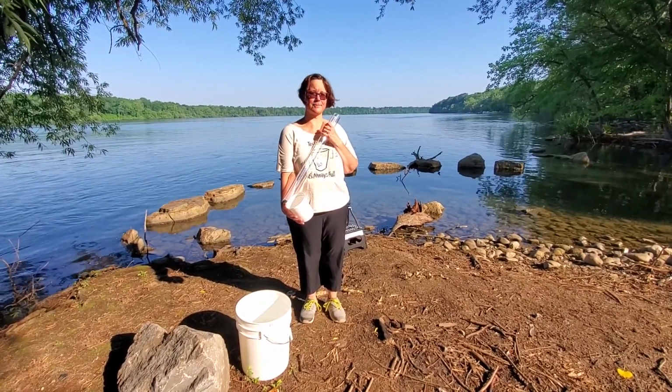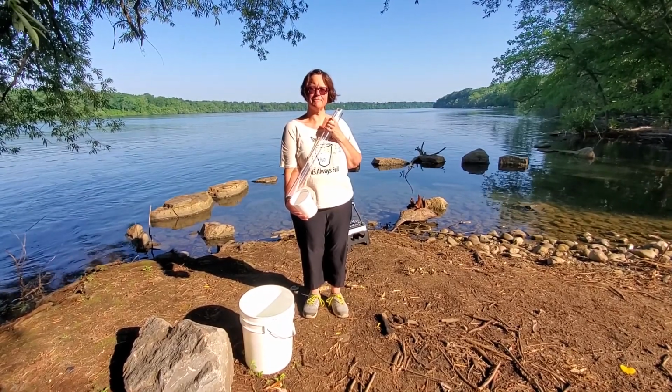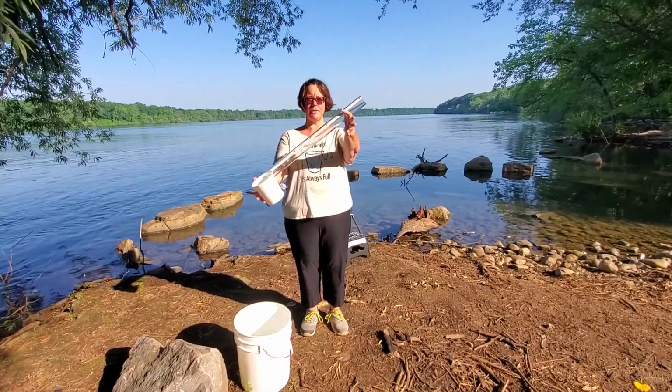Today I am joined by Mrs. Feuerman, the 8th grade homeroom and biology teacher. She's going to get us started on our first experiment and explain what this is. This is a turbidity tube.